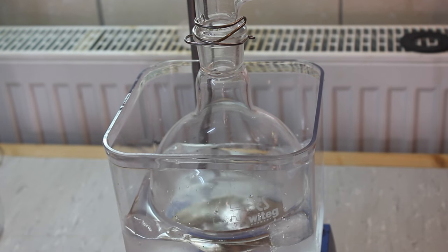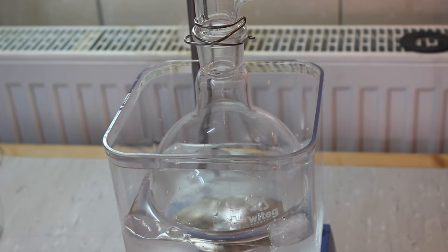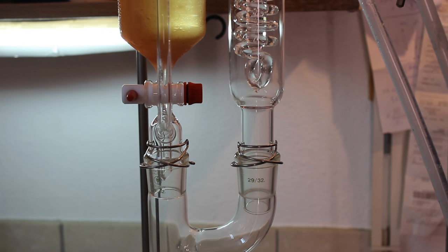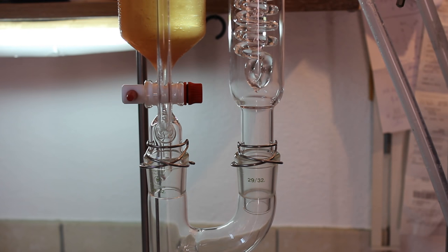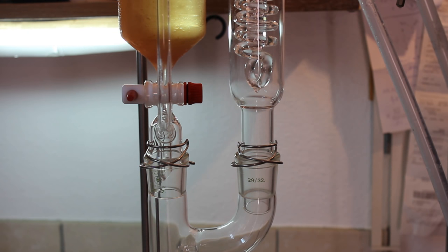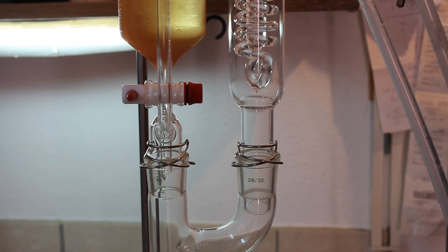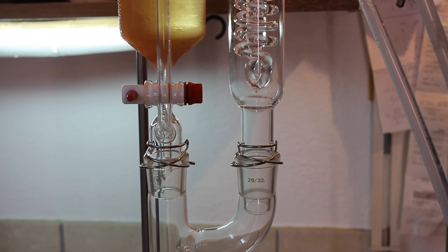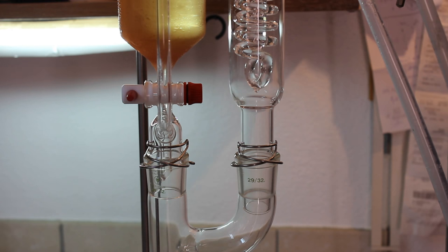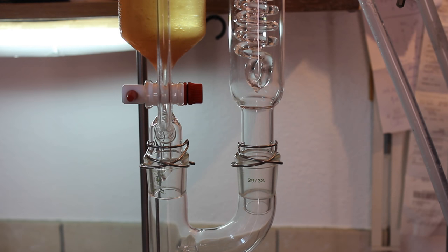I've adjusted a constant drip rate and now we wait for the addition to finish. All of the sulfuric acid has been added and I filled up the addition funnel with our hydrobromic acid. We can start slowly adding it to our reaction flask while maintaining a low temperature.